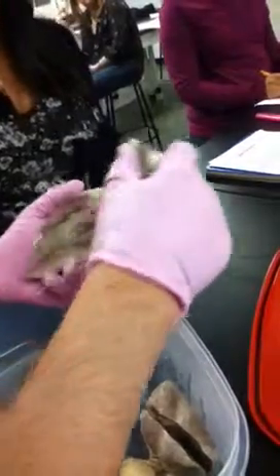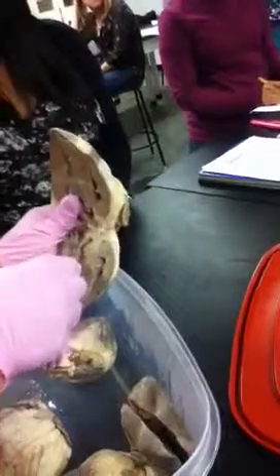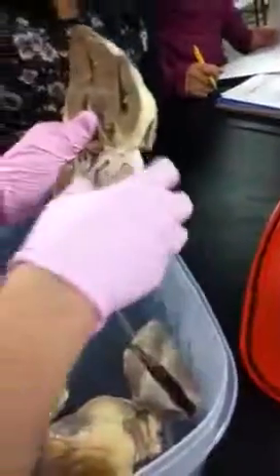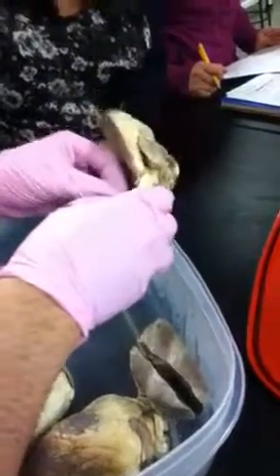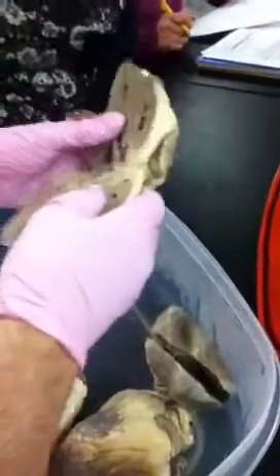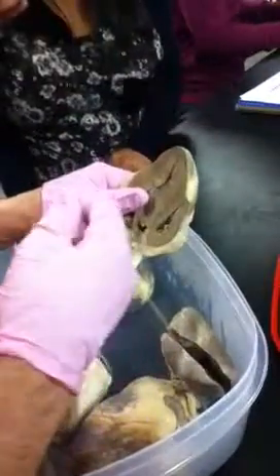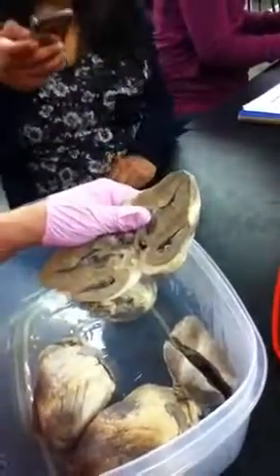There you go. So, just turning it around, if it's something tagged here that's circled like a string, it's going to be the chordae tendineae. If it's actually at the top of the string, right, it's going to be the AV valve, right?